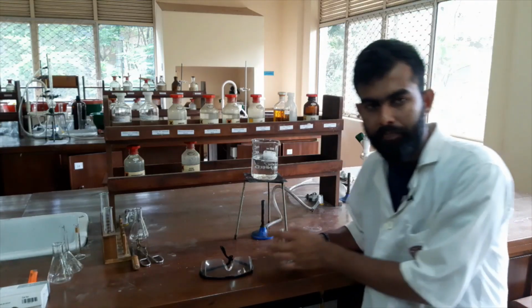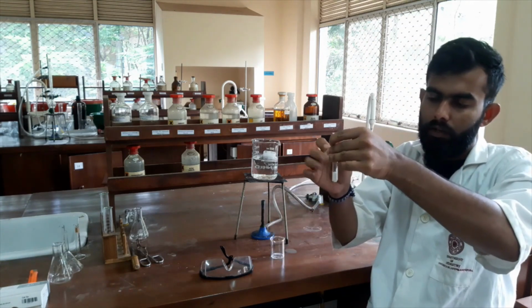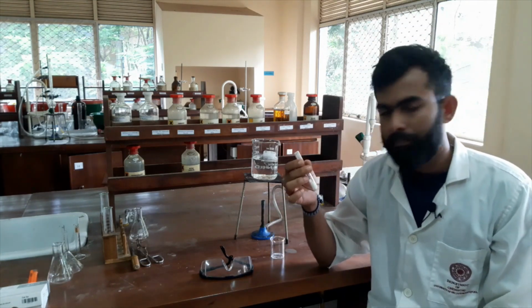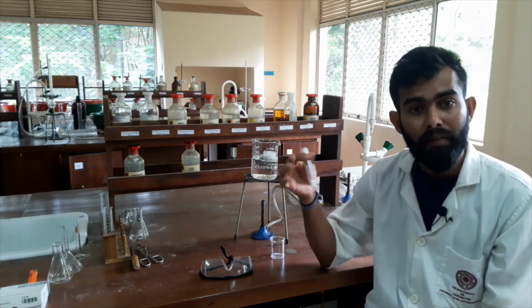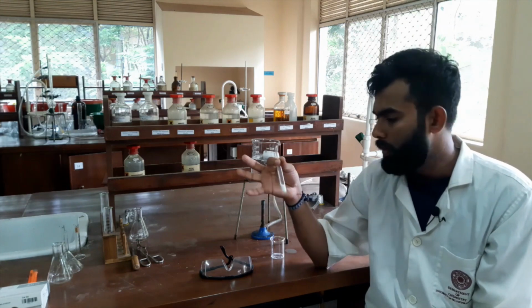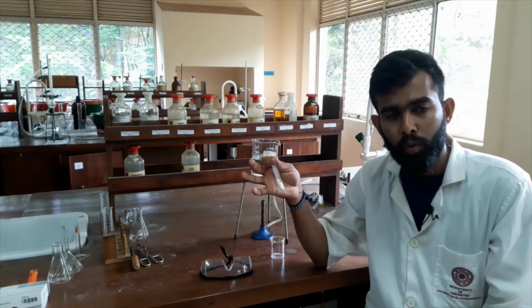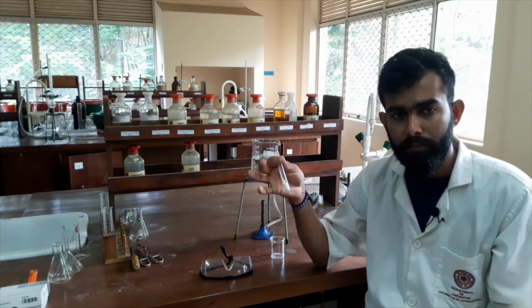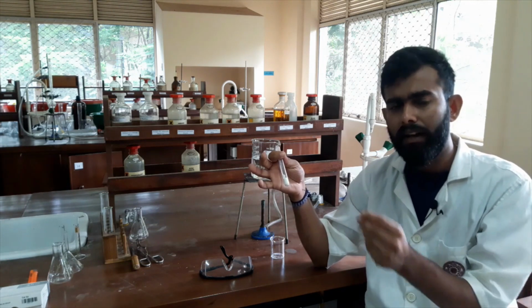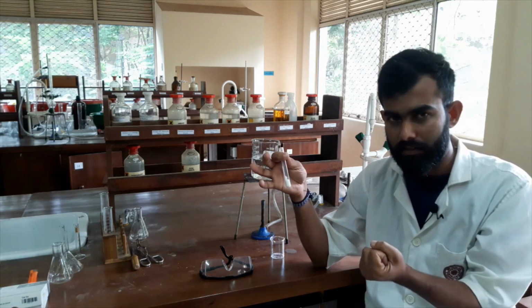Okay, here I have a chemical sample. Here I don't know what the chemical is, and I have 1 gram of this sample. So just assume I don't know whether it's very pure or not. I don't know its purity. However, I guess there are some impurities there. So I want to purify it.